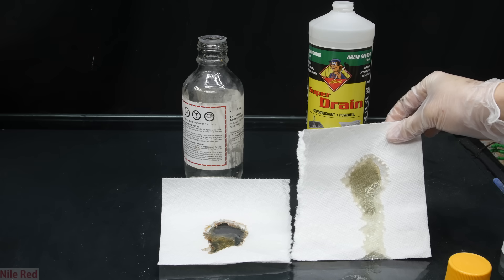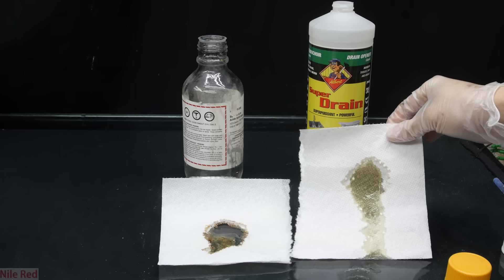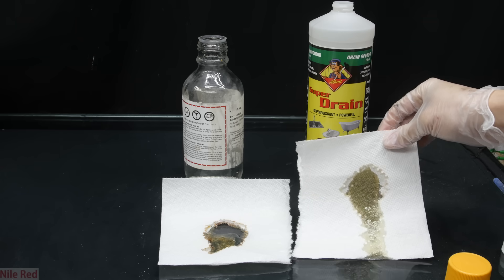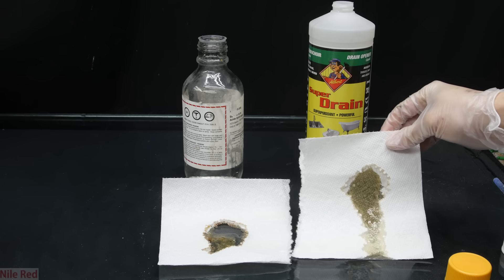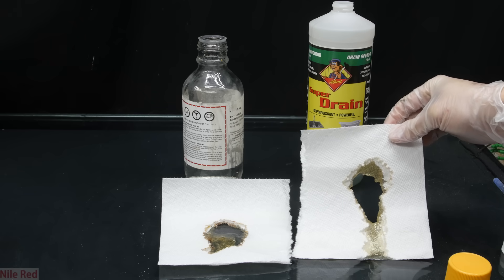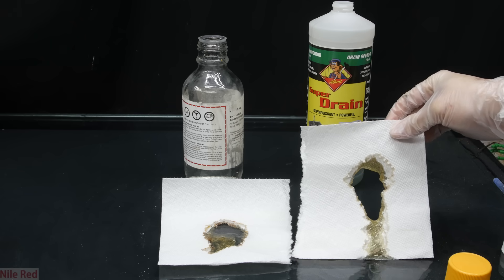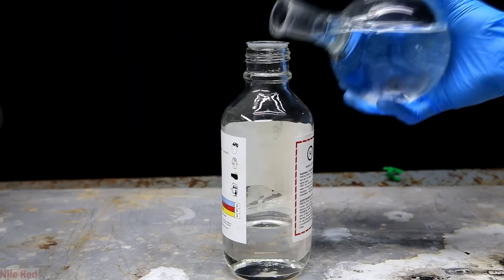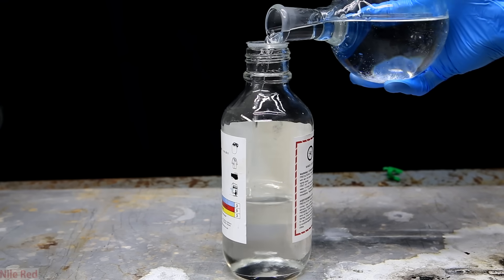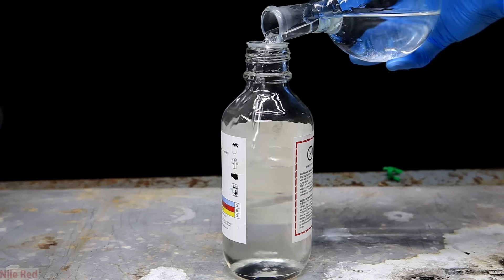Unfortunately, the drain cleaner sold in most stores is discolored and it's not concentrated — it's usually only around 93% instead of the concentrated 98%. So to get this sulfuric acid in good shape, we're going to have to concentrate it and purify it.